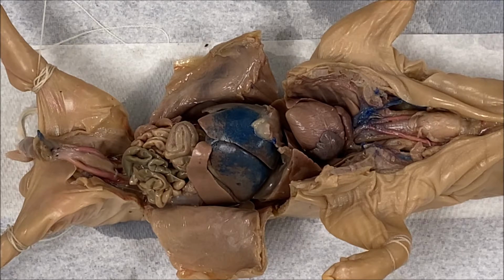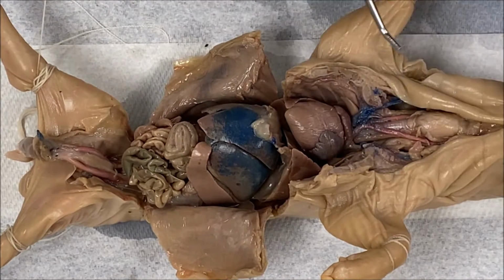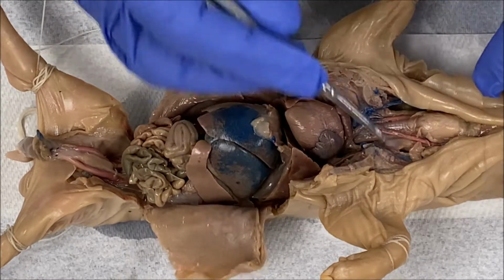Now that we have opened up the abdominal area, we can begin studying the different organs of the digestive system. Okay? So starting from mouth to anus, you have the oral cavity, right? And then from the oral cavity, what you can't see is the pharynx. And then below the pharynx, you have the esophagus.